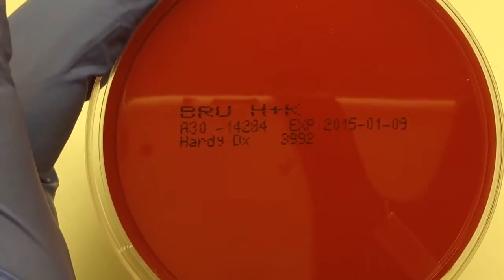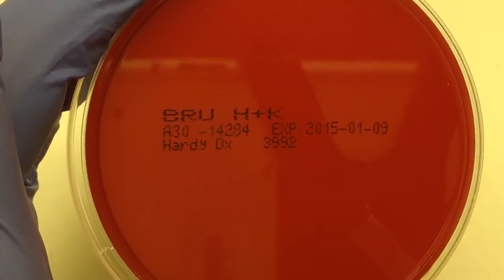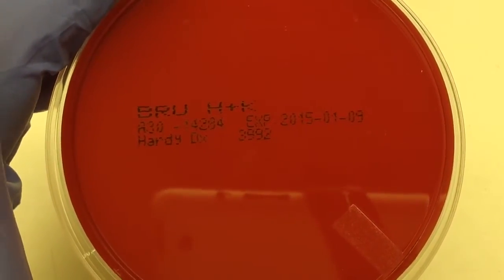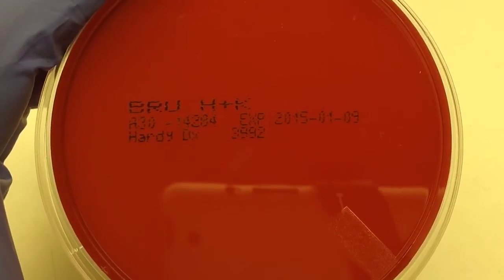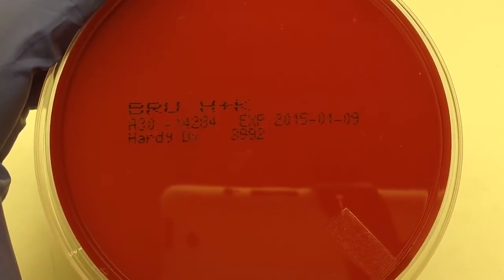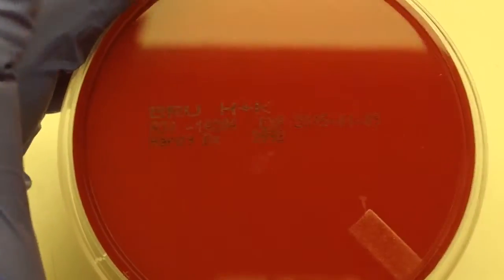Our last plate is a Brucella plate. In the facility that I'm in, this is what they use primarily for when anaerobic organisms are suspected.